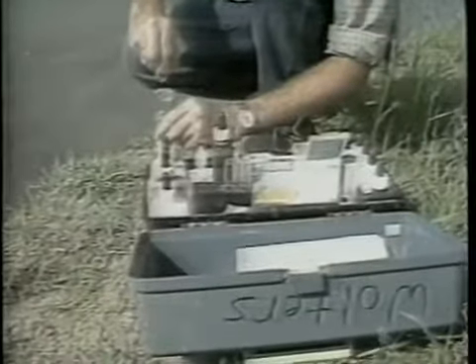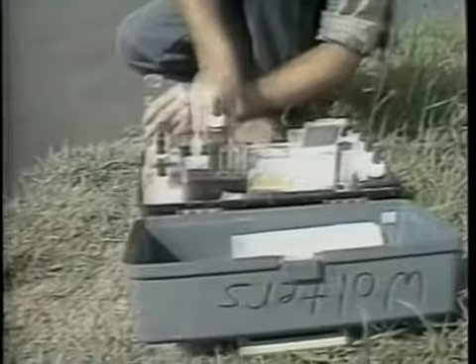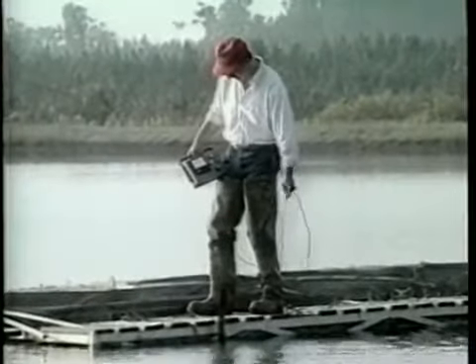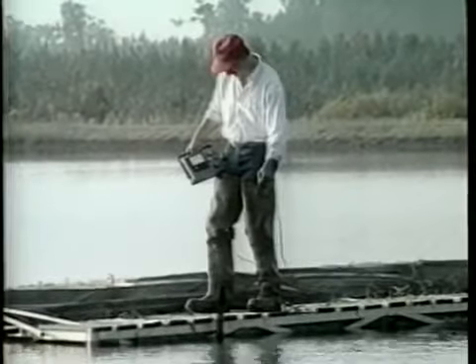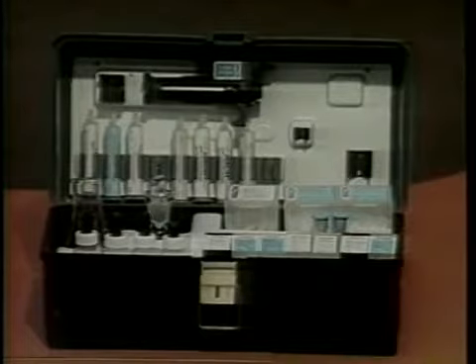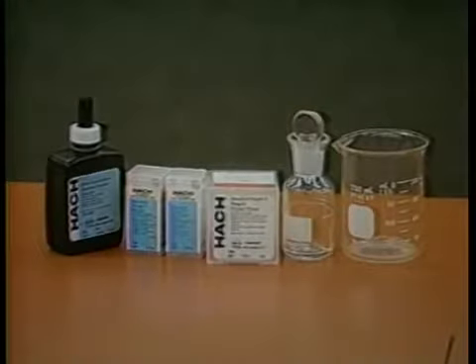The kit method is usually more practical for a small producer or pond owner, while the use of meters is usually preferred on larger commercial operations. Kits may be purchased from scientific supply companies or from fish farming supply houses. Included in the test kits are a high-range and low-range method for dissolved oxygen determination. Initial testing should start with the high-range method.